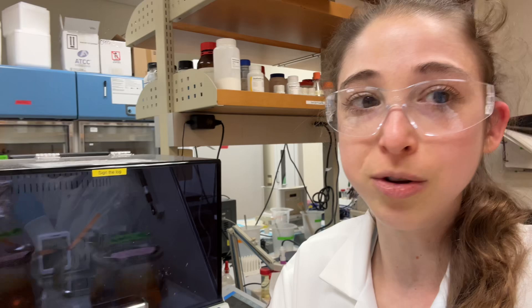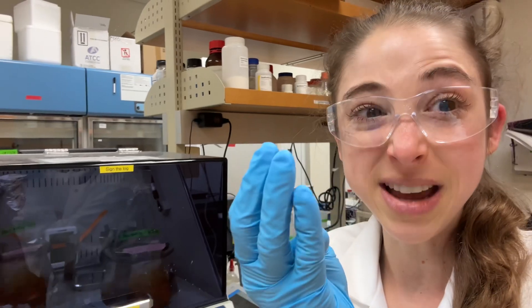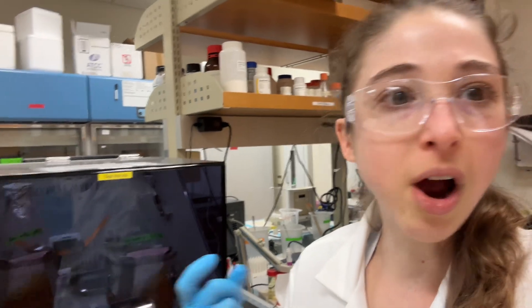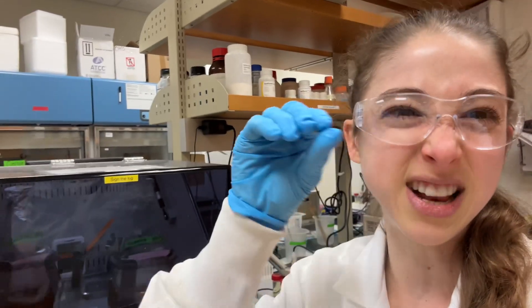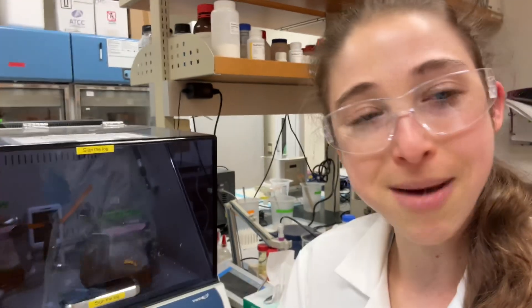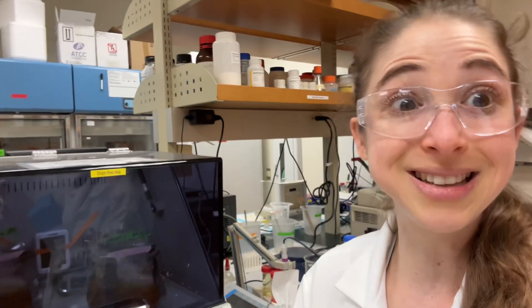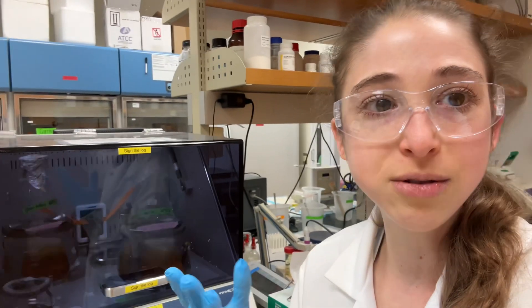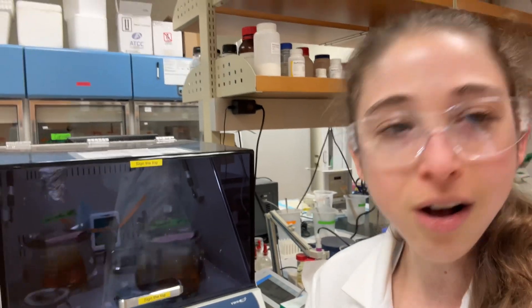We took a sample beforehand so we can run a gel and see if there's a band at the expected molecular weight in the pre-induction culture. Then when we harvest it, we'll take another sample, run an SDS-PAGE gel, break open the cells, look at the proteins, and see if there's a nice big fat band. We're actually hoping to see two bands on two different gels, because we're trying two different proteins: malate dehydrogenase from Bacillus stearothermophilus — which is the one we're really excited about — and Bacillus subtilis. We'll compare these proteins and look at how they're adapted in their respective bacteria and how they respond in different conditions.